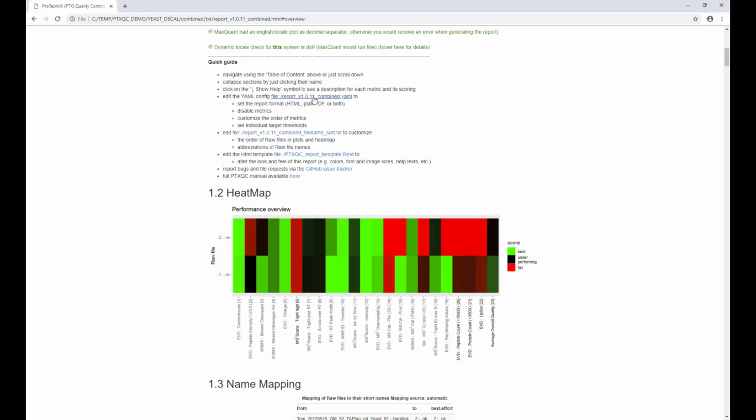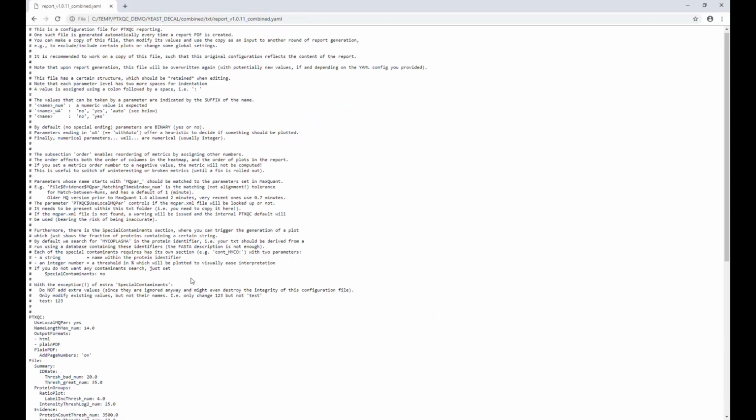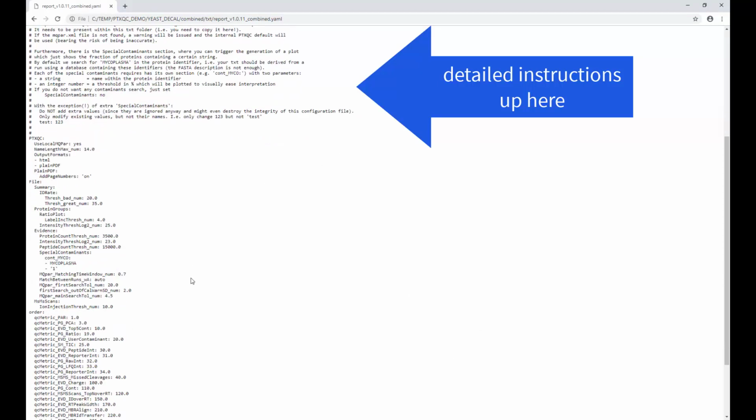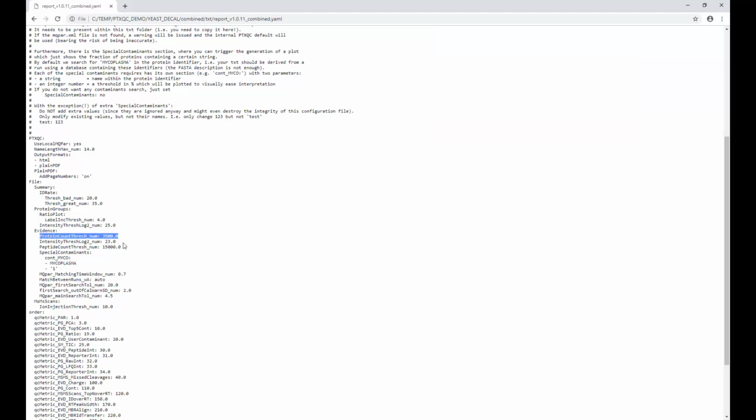Going back, you have a config file, which is right next to the report. We talked about this earlier. So you can look at this config file, and this is basically how PTXQC was configured, and we just used the default configuration. If for some reason you want to change that, for example, you could say, well, I only want an HTML report, I don't want a PDF report, you just delete the line here and save some time. Or you can set individual thresholds, for example, for the total number of proteins you expect per sample. This is something that PTXQC cannot know because it depends on the sample type and your settings and your instrument. So this is something you can set, and this will influence the scoring of some of the metrics.